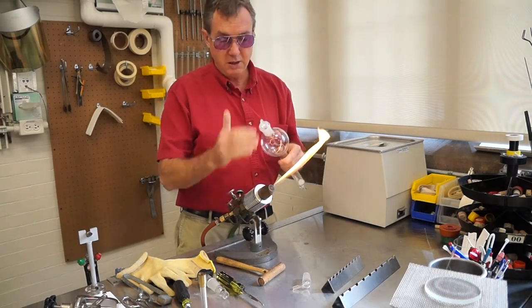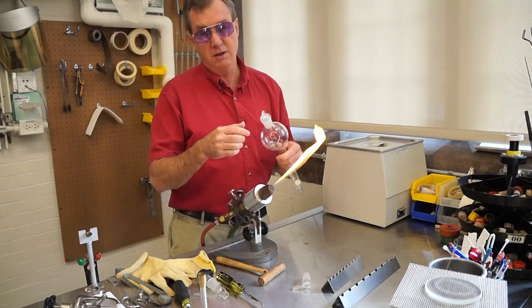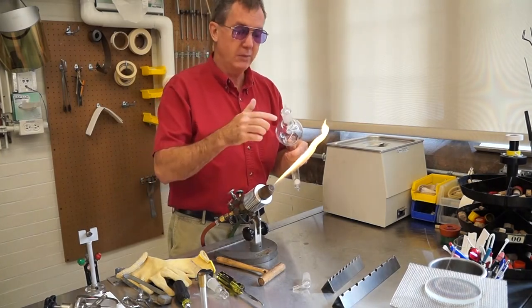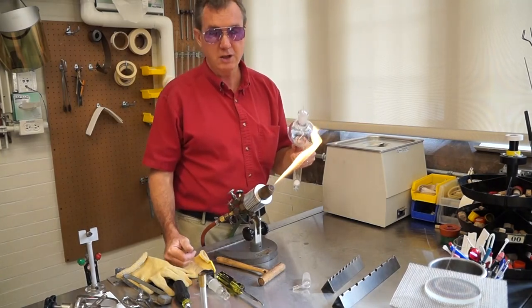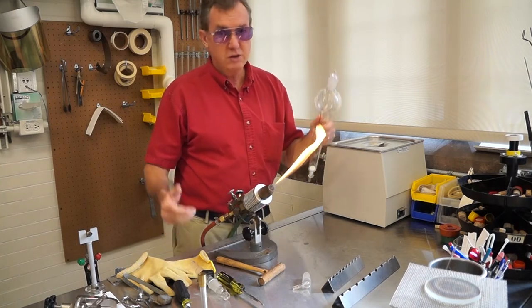If nothing else, we can cut off the connection and pull the sample out and repair the glassware. Any questions, come to the glass shop.